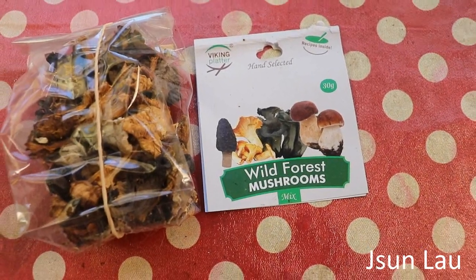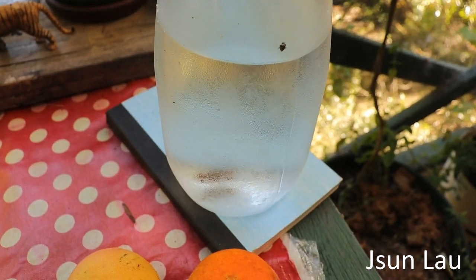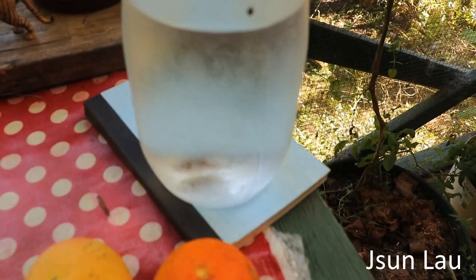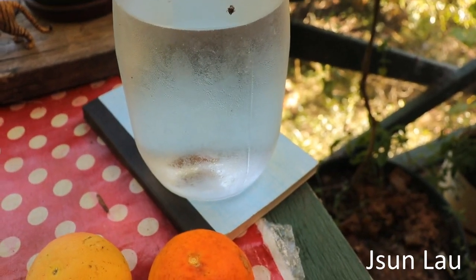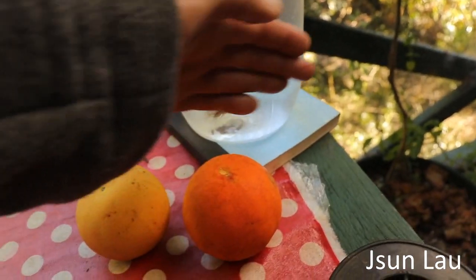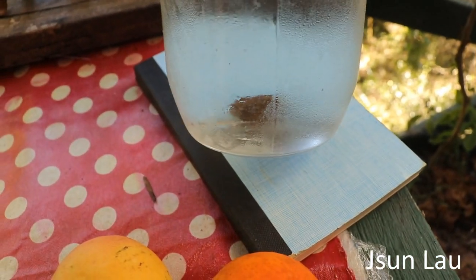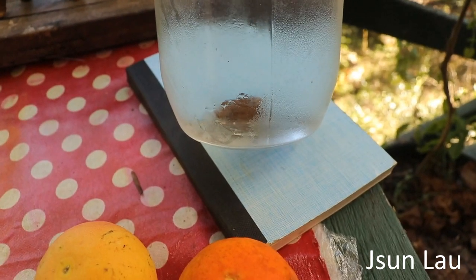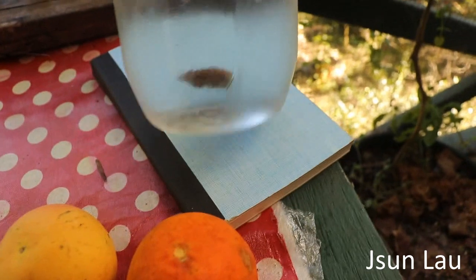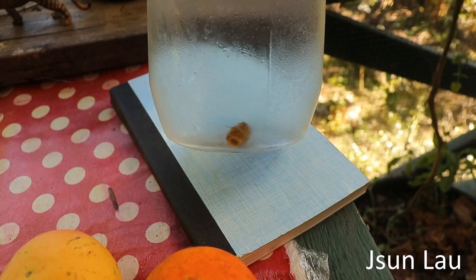I've taken them out and put them in a jar of cooled boiled water with a bit of corn syrup — about a tablespoon to the litre. After a few days all the spores germinate and start to get little floaty bits of mycelium.